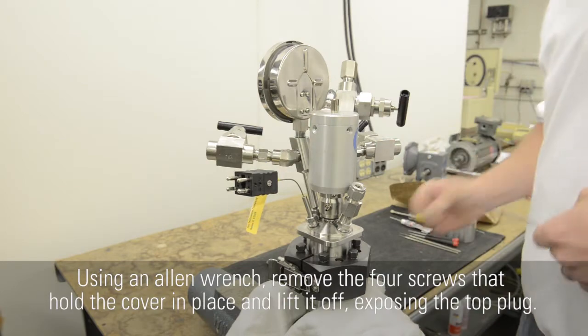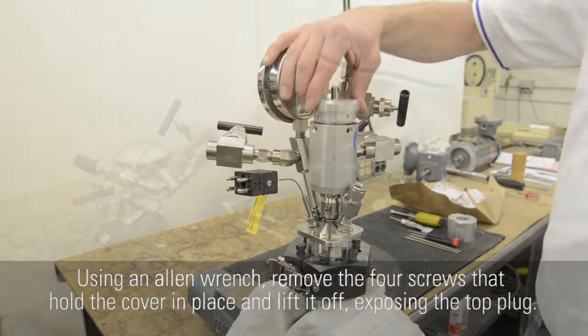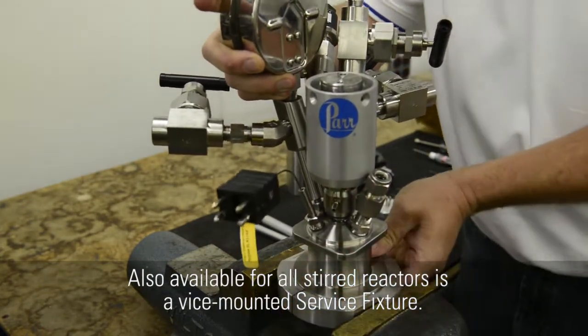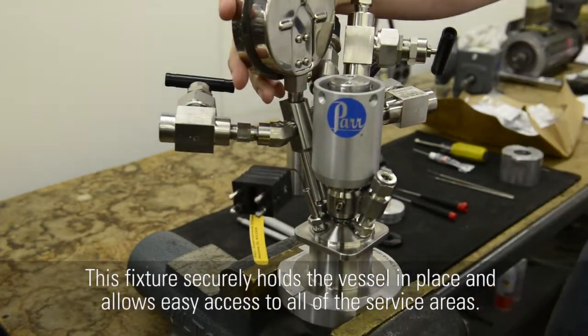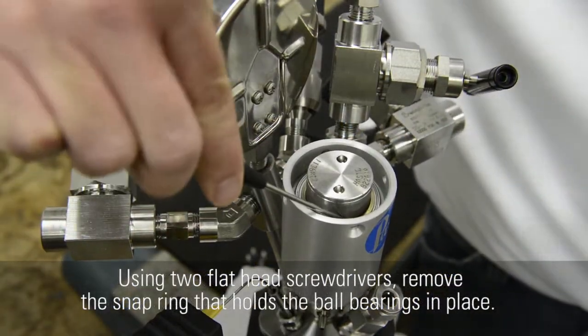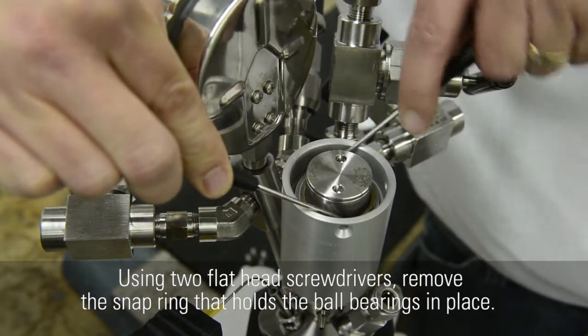Using an Allen wrench, remove the 4 screws that hold the cover in place and lift it off, exposing the top plug. Also available for all stirred reactors is a vise-mounted service fixture. This fixture securely holds the vessel in place and allows easy access to all of the service areas. Using 2 flathead screwdrivers, remove the snap ring that holds the ball bearings in place.